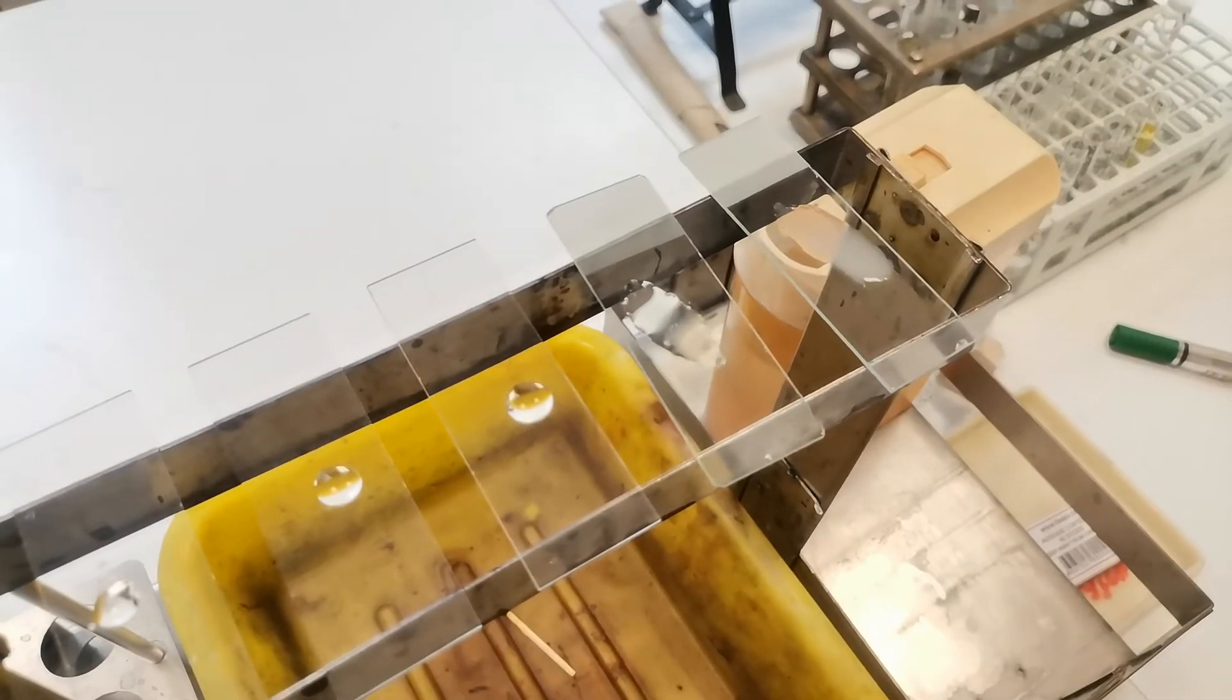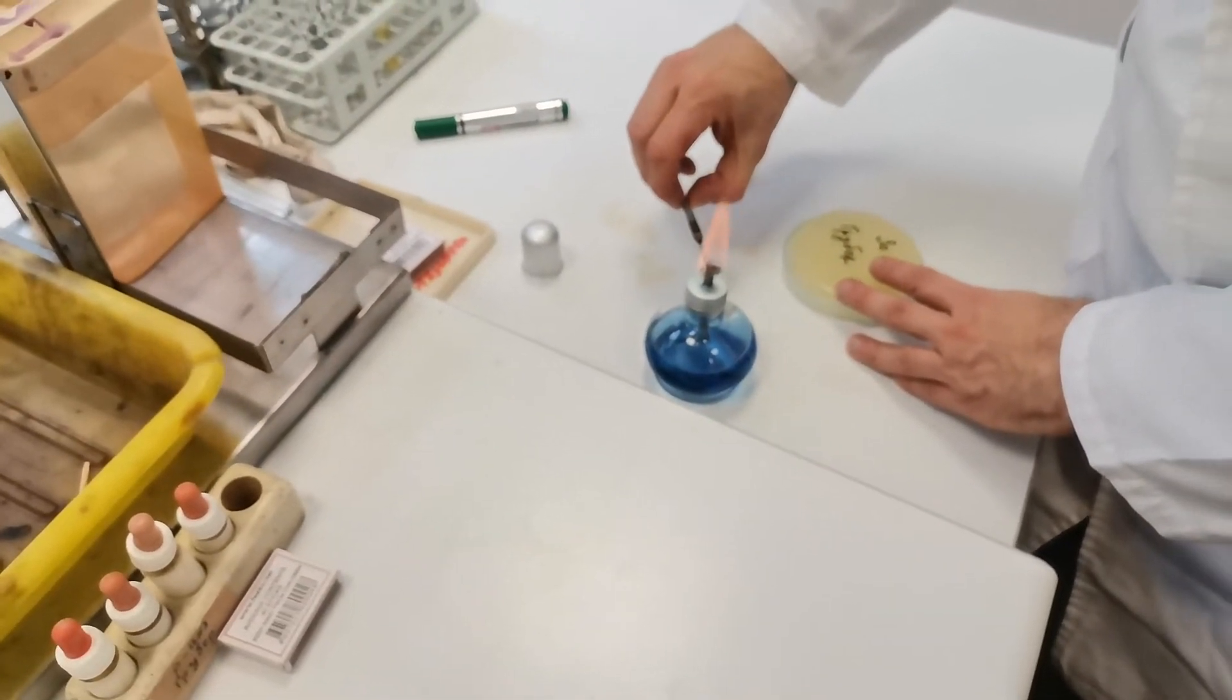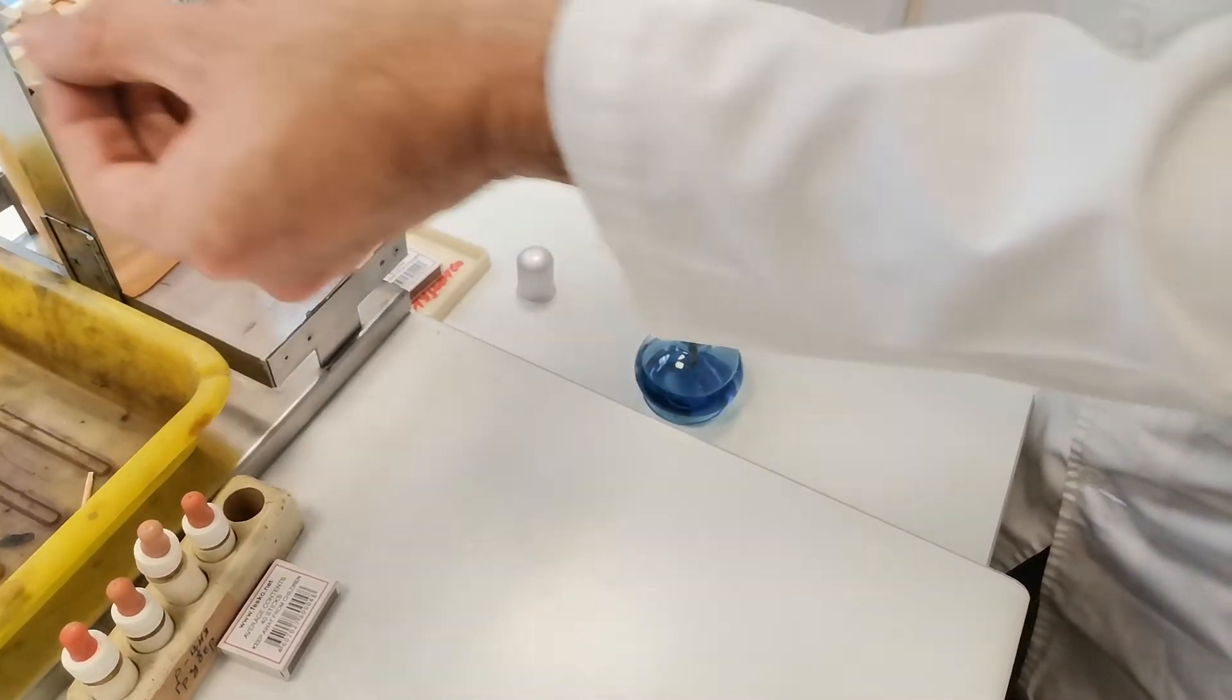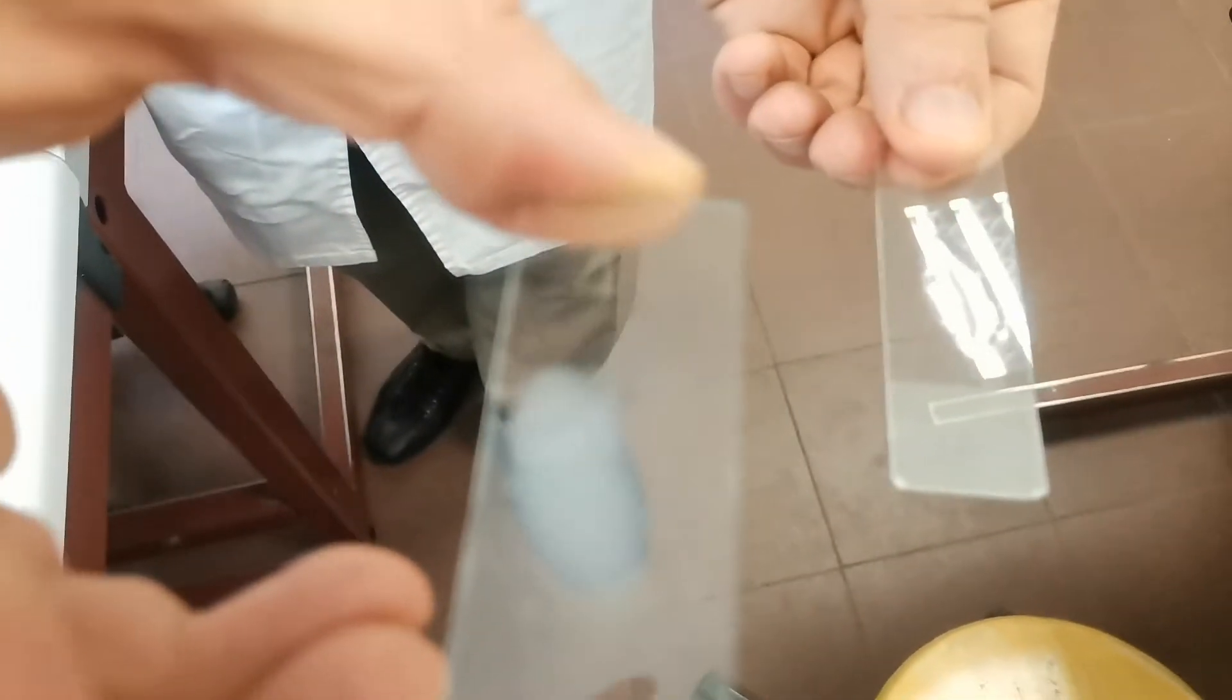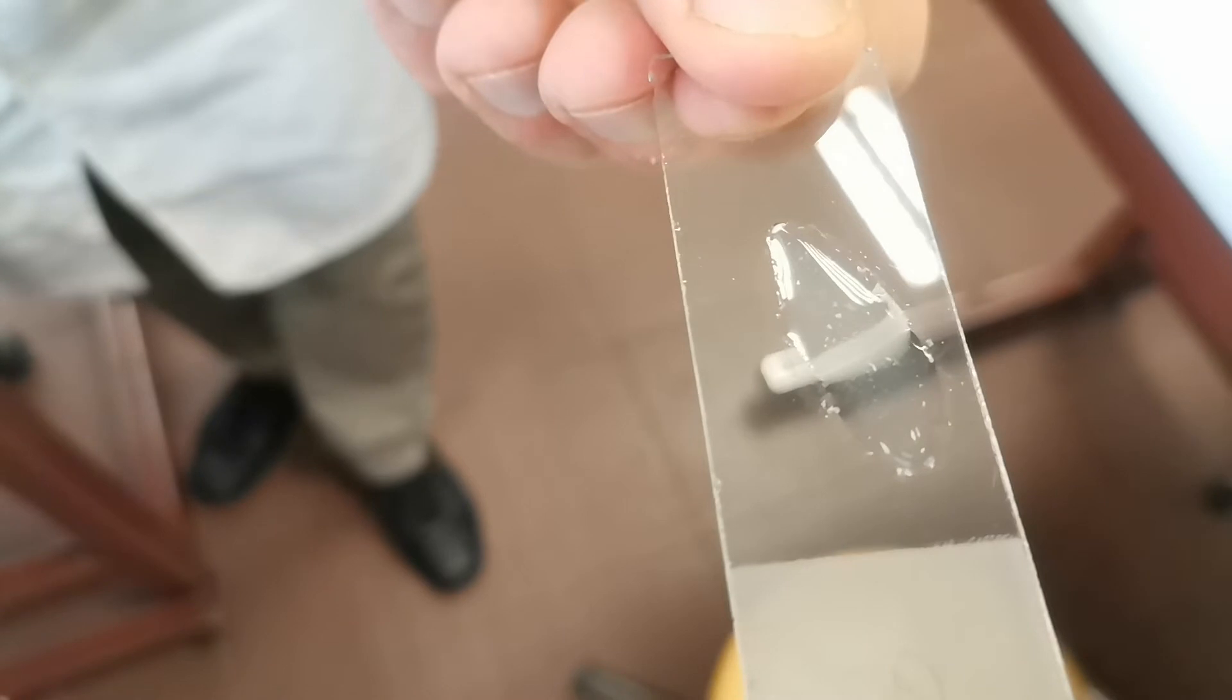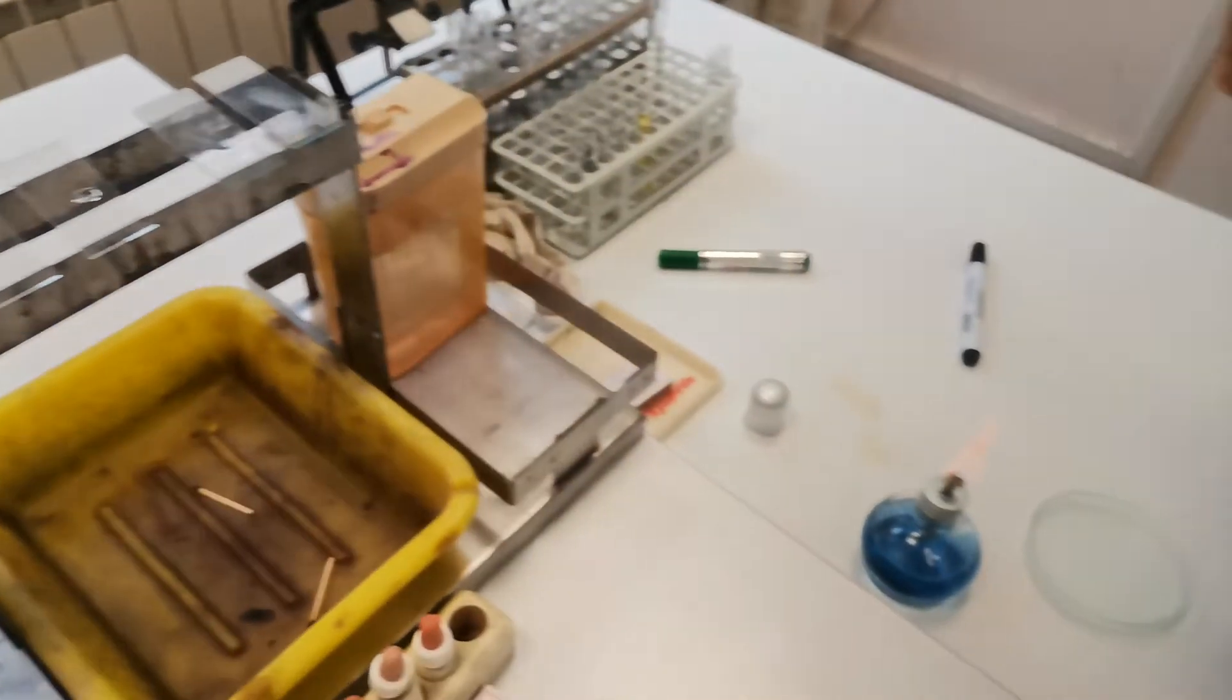Don't forget to burn the loop. You can see the difference between the negative reaction, the negative control, and the positive, where the drop is clear. And there are grains. Of course, I need to go on and do it with the other drops as well.